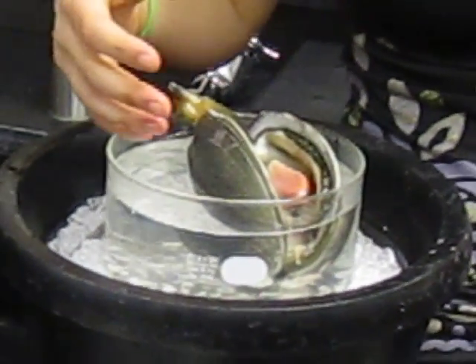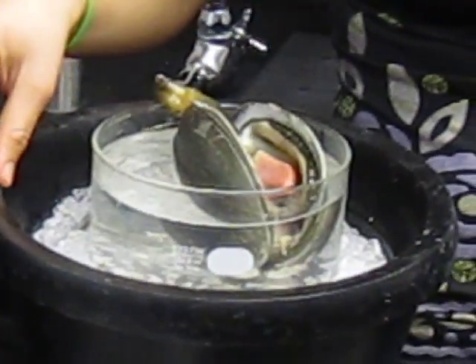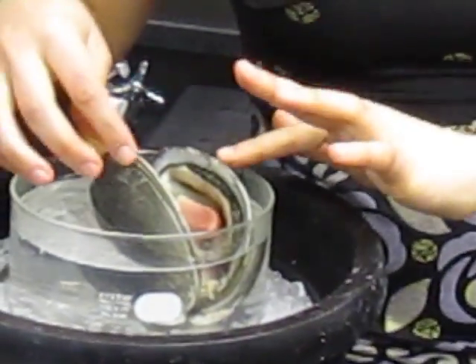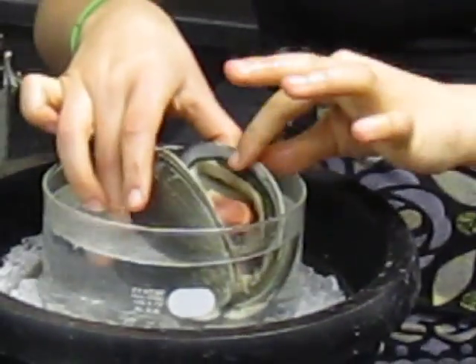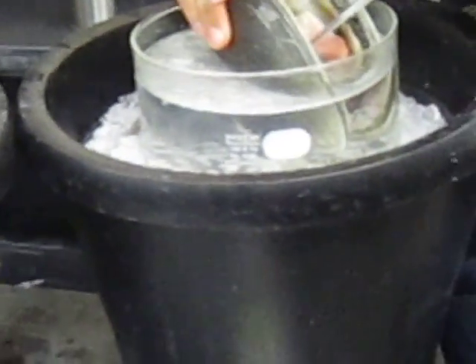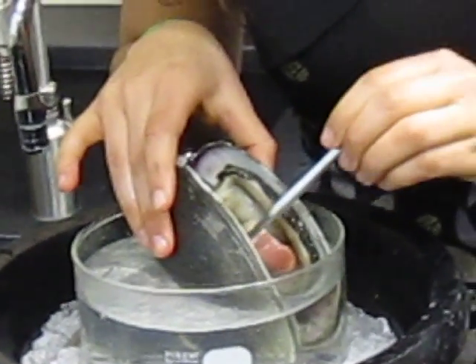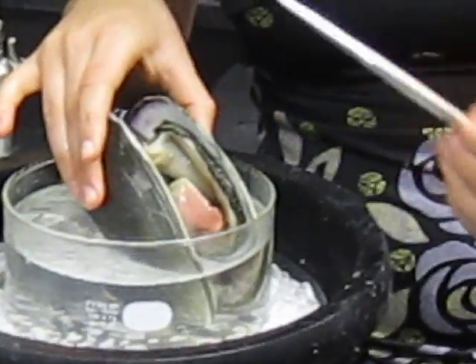So you need to have a gas exchange organ. Make sure to know what all the analogous structures are in various other organisms, different phyla, different classes within, well, it's Bivalvia and mollusks, but make sure to be able to recognize those. Can you point it out again? Yeah. You see better. See right here? These white, they're like flappy, yeah, these guys. And so they're pretty significant. They're little flaps, there's a lot of them. They have lines on them.